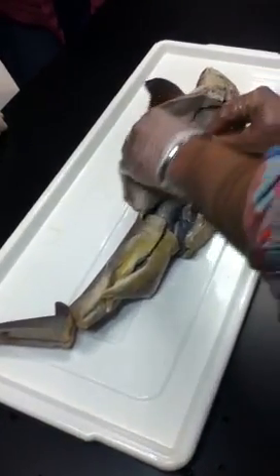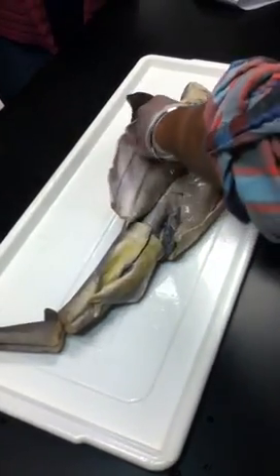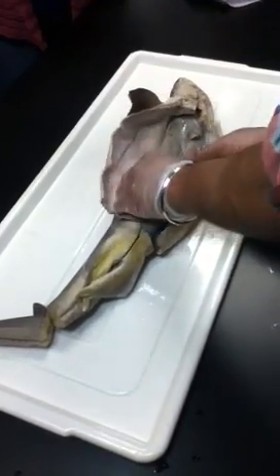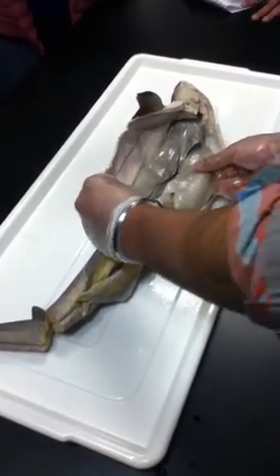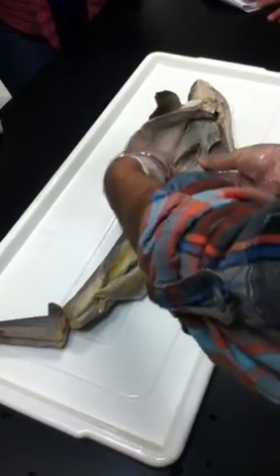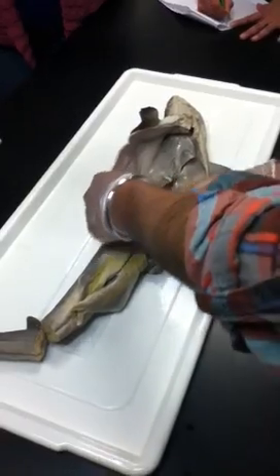Basically to store energy, and also it's part of decreasing the density and increasing the buoyancy of the shark as well. I remember the first part, reading it. Yeah, we mentioned that part. The storing energy.